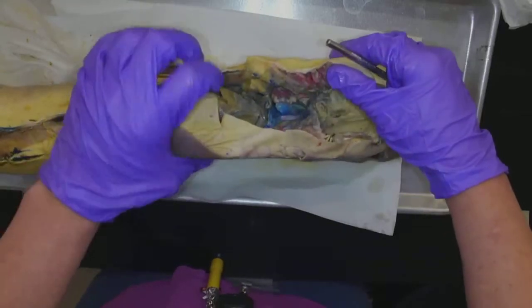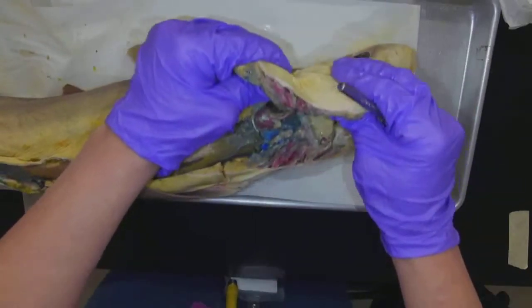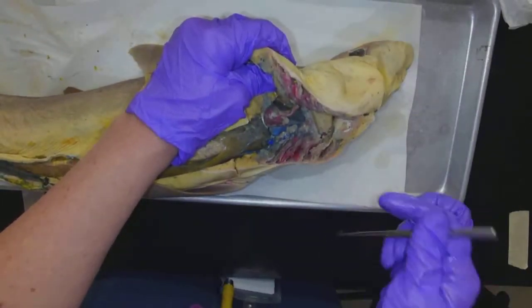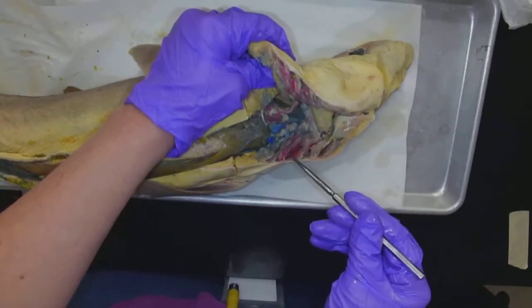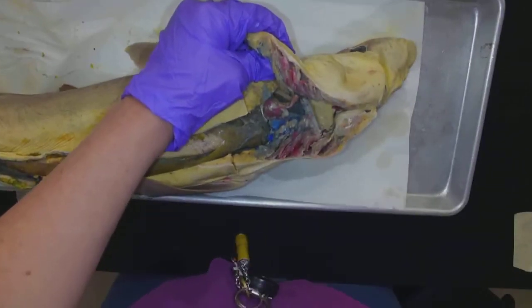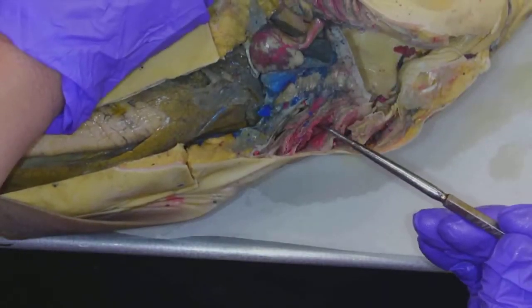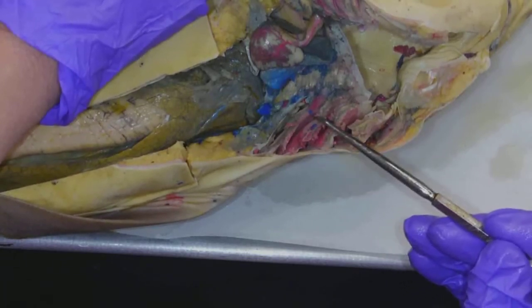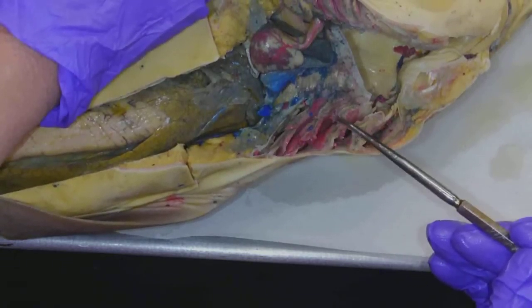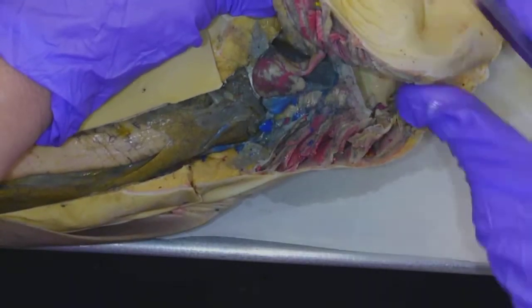So if I open up the mouth — I had to really cut into there — I can see right here, these are the gills. These here are the gills, and you can see that pink — that's from the latex, and that's blood. So each of the gills are in here. I can see them on the top as well.